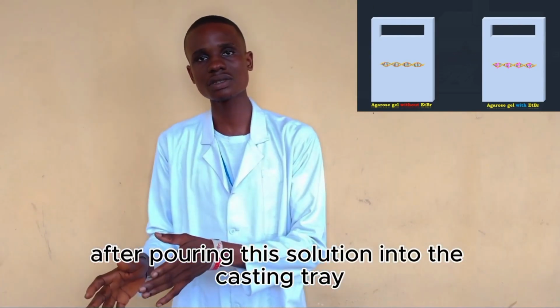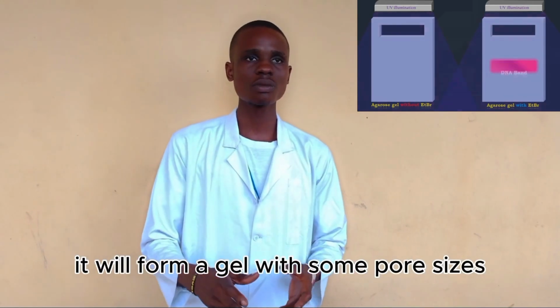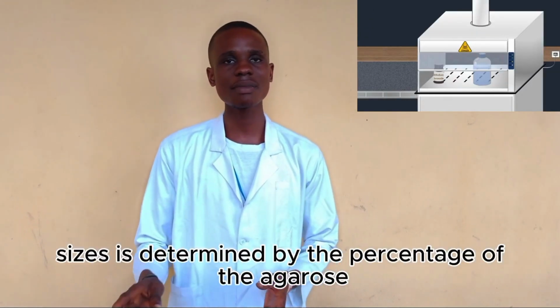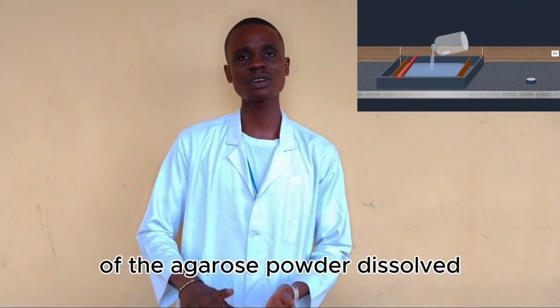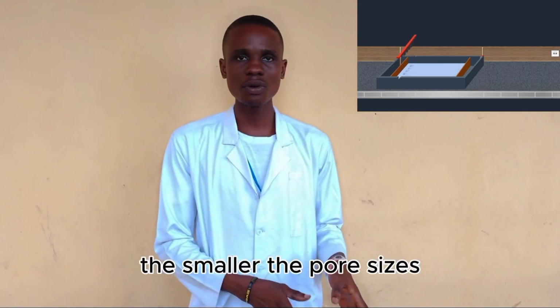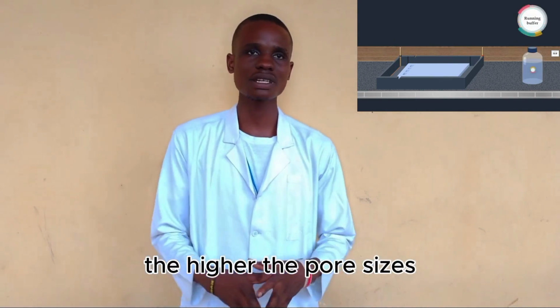Now, after pouring this solution into the casting tray, on solidification, it will form a gel with some pore sizes, and the pore size is determined by the percentage of the agarose powder dissolved before heating. The higher the percentage of the agarose powder dissolved, the smaller the pore sizes, and the smaller the agarose powder dissolved, the larger the pore sizes.